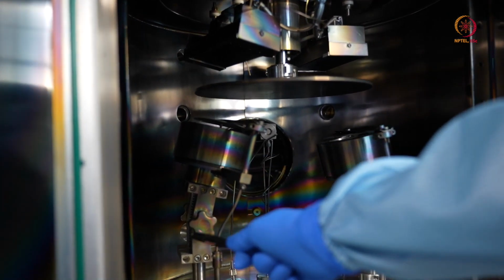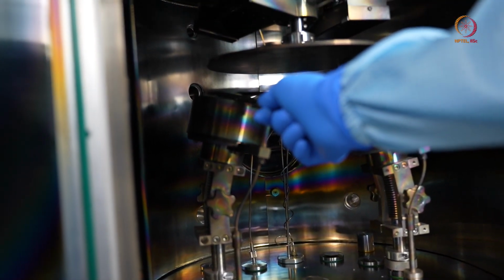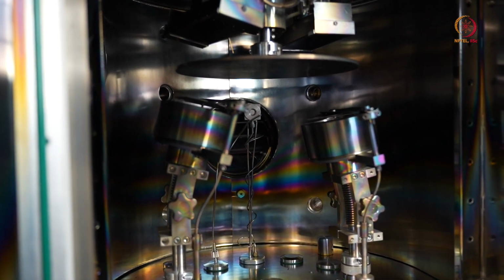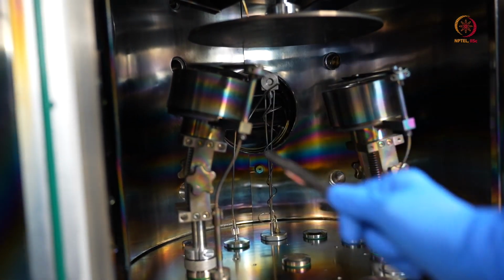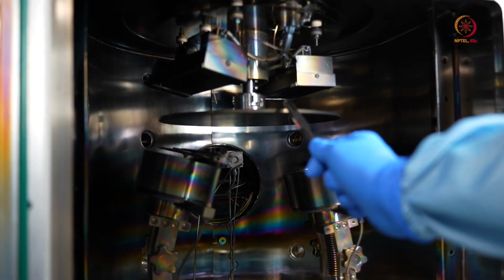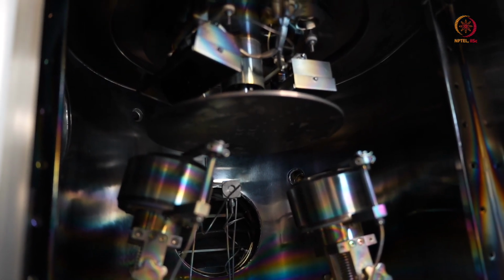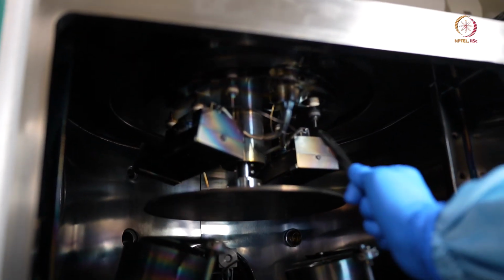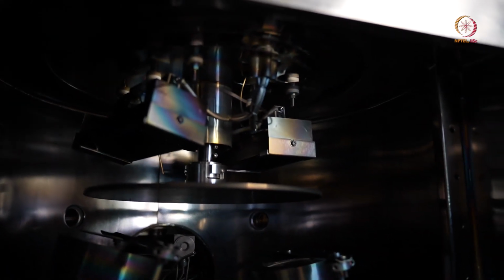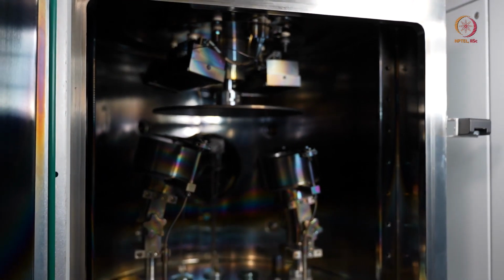In this electrode setup, there is an adjustment for the height as well as the angle, and inside this we have the target. For example, I had shown you a copper target a few minutes before, that is placed inside this, and there is this shutter which covers the target. Then we have here the substrate holder, which keeps on rotating during the deposition to ensure uniformity. Above that, we have two heaters. In case you want the sputtering to happen at a higher temperature, we will switch on the heaters. So that's it, and we can now start with the process.